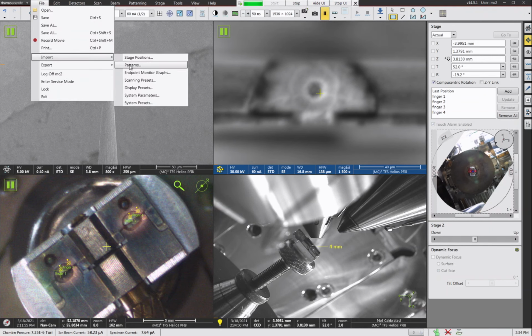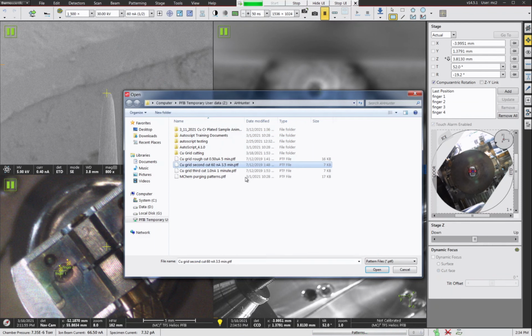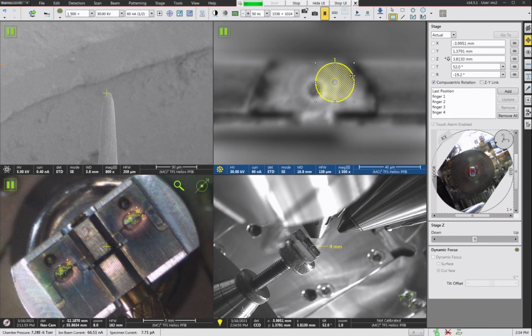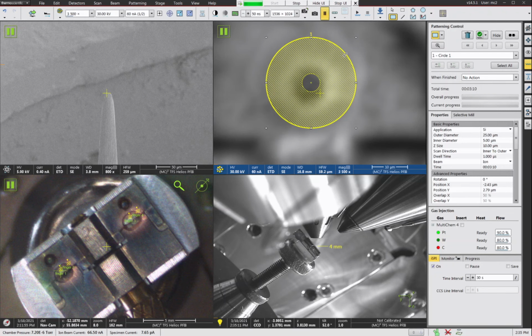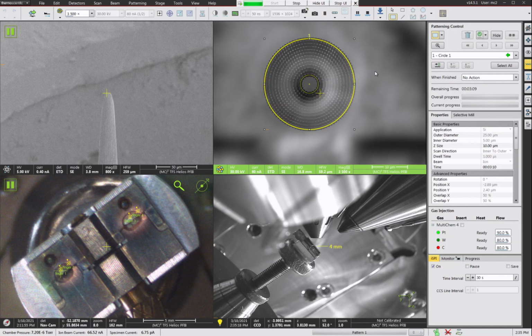And we're going to go ahead and import our second pattern here. So I got my copper grid second cut, which is simply a donut pattern. So it's just a basic circle with a center circle area. It's a 25 micron outer diameter and a 5 micron inner diameter and 10 micron depth using the silicon application file. So just put that on the top of the post as best you can, and we'll go ahead and run it. And you see this is a 3 minute and 10 second pattern. And again, I'm going to go ahead and pause the recording until this is nearly done so that you don't have to wait for 3 minutes of nothing.